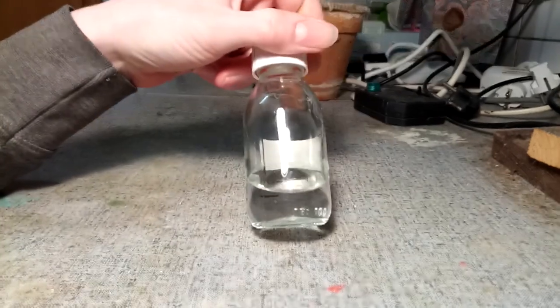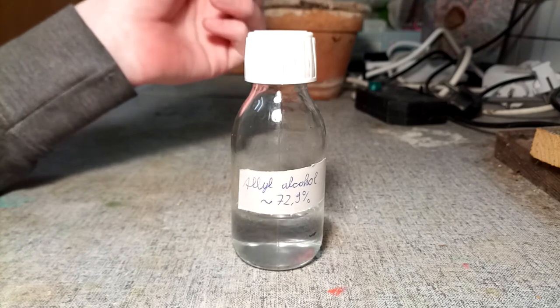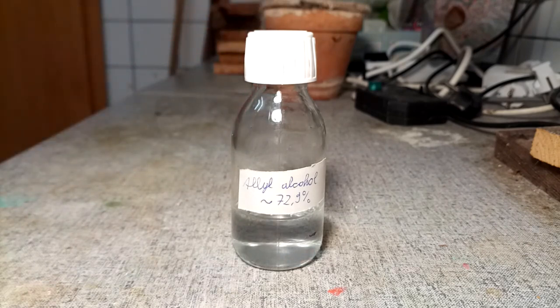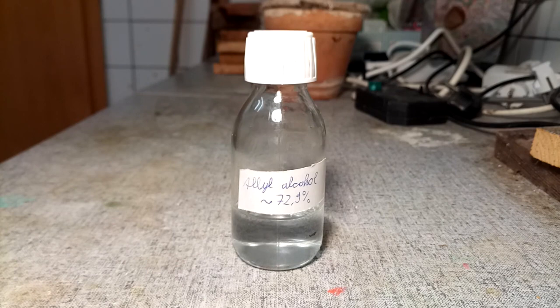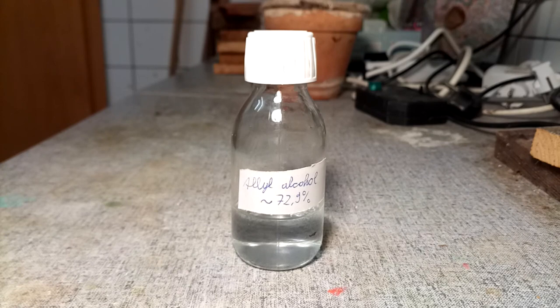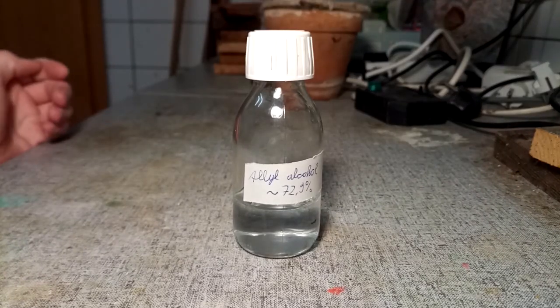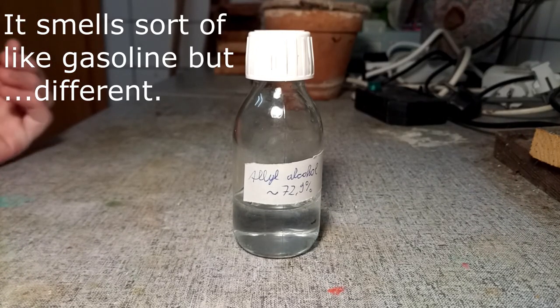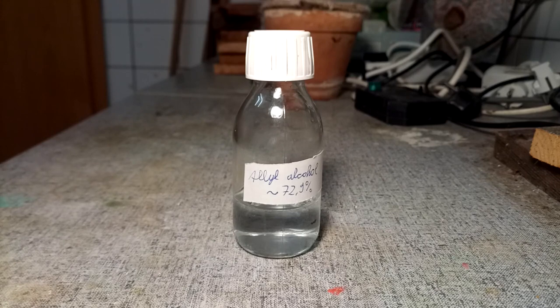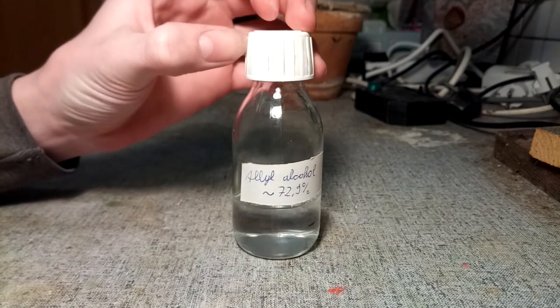I don't know exactly what kind of yield this is, but it looks to be about 50%, which is actually pretty good seeing how I used quite a bit lower concentration of formic acid — 75% where I should have been using 85 or even 90% for good yields. Also, the reaction should really be done in an inert atmosphere because otherwise things will oxidize and reduce yields, and I didn't do that. But it still worked. It's definitely enough for what I'm trying to do. It's still got its very pungent smell — well, the smell isn't exactly pungent at first, but then it just hits you and it hurts. It makes your throat hurt, it makes your eyes water. Definitely good ventilation is needed for this, and maybe a bit of a skill in holding your breath.